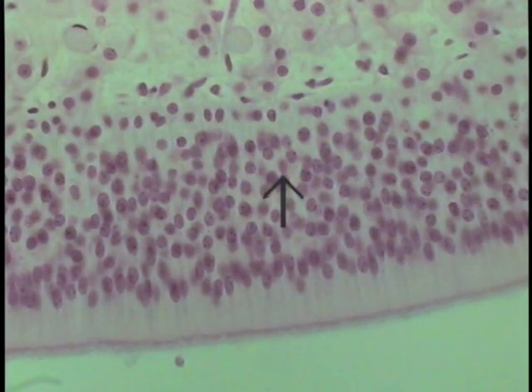One might imagine a little bit that these are the dendritic terminals here, but there's no way that we can prove it. If an oblique section is obtained, one can actually trace the processes of these cells to the surface, and an olfactory knob is observed, then one can be fairly comfortable you're dealing with a bipolar neuron, short of specific staining.